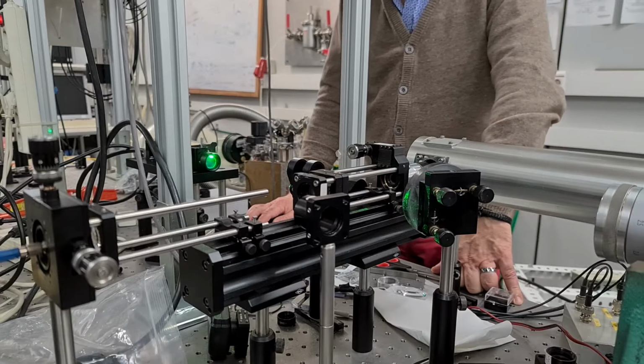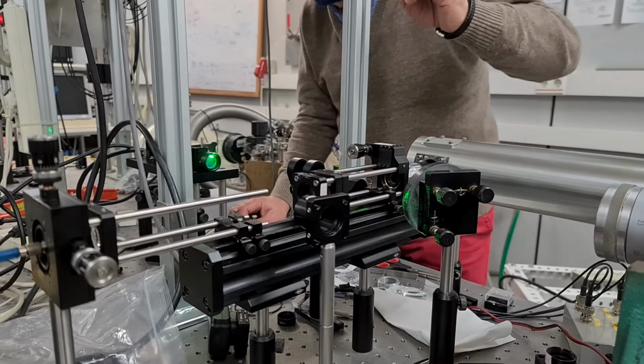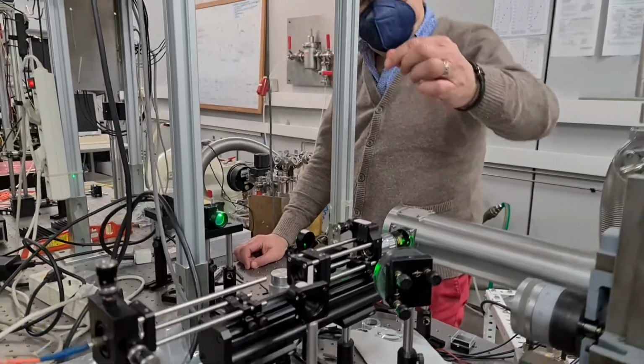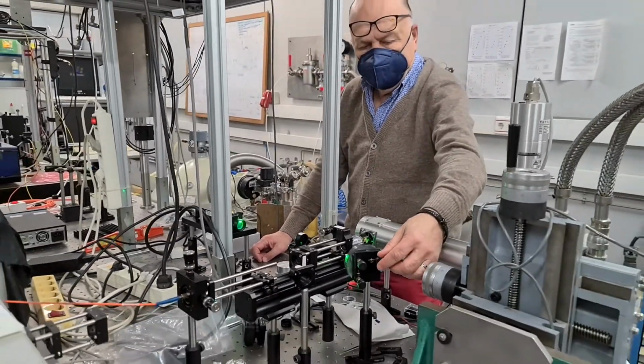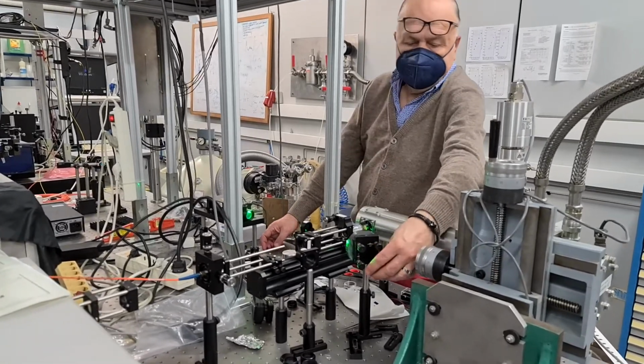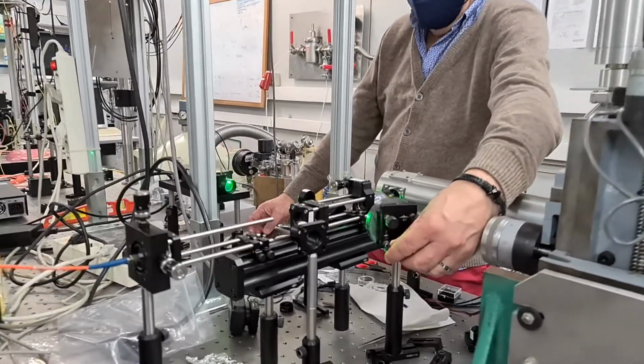This is the setup we use for photoluminescence of lead-free perovskites under steady-state and transient conditions, using appropriate excitation lasers as a function of temperature. This gives us information to understand the exciton and carrier dynamics of the material.